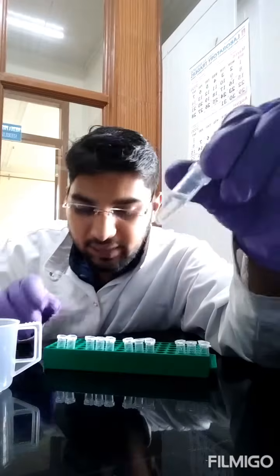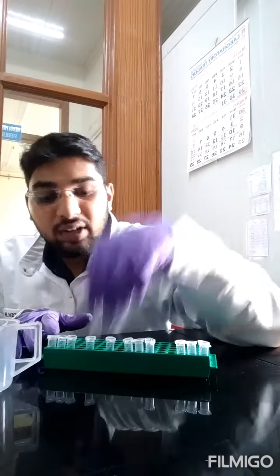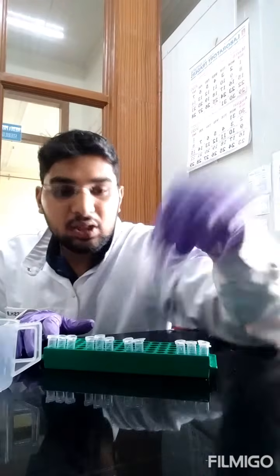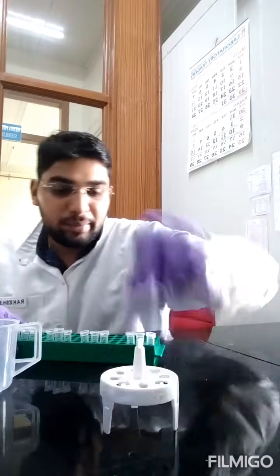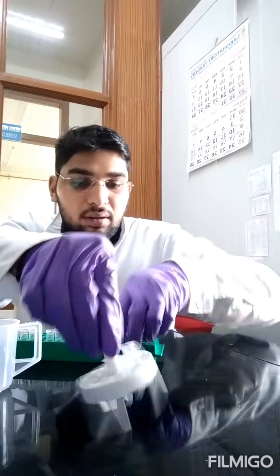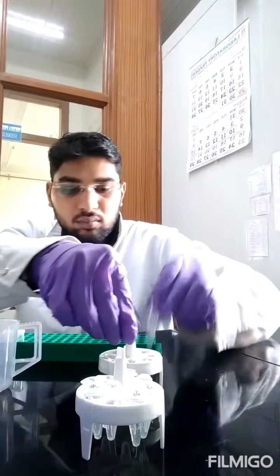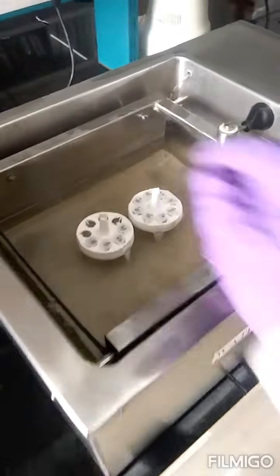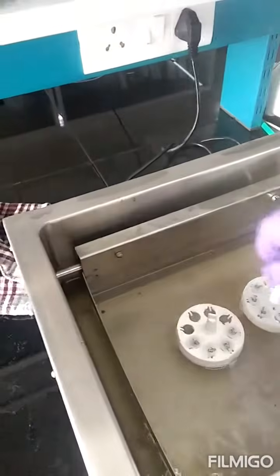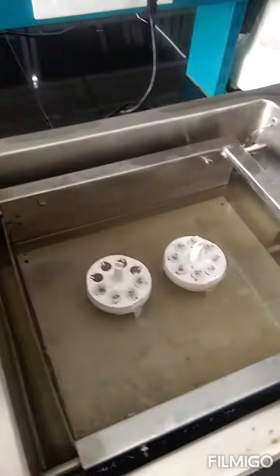Now you can see there is no color developed in any of the samples, but after keeping in the water bath, the amino acid that we are estimating, proline, will react with the acid ninhydrin and will form a red color layer, which we are going to separate using toluene. For the reaction to occur, we are going to place this in a water bath. This is a stand for the Eppendorf tubes. We'll keep it in this stand in a boiling water bath for 1 hour. You can see I have placed the Eppendorf tubes in the boiling water bath. We will leave it here for 1 hour for the reaction to occur, and we need an ice bath to immediately arrest the reaction.